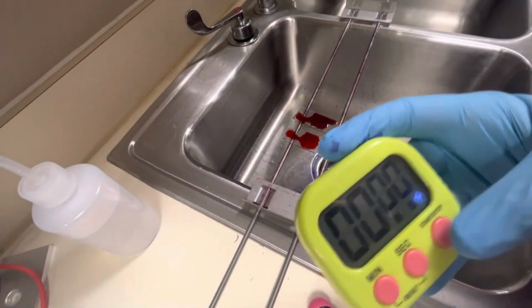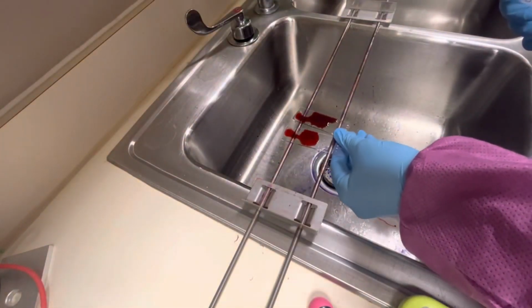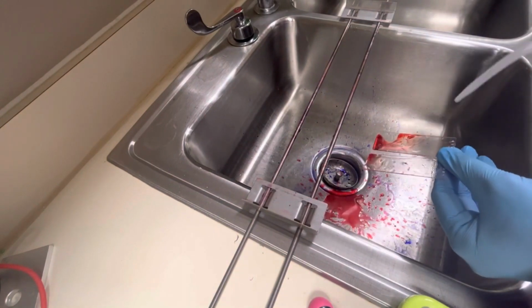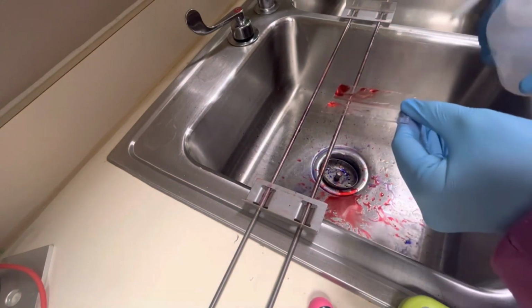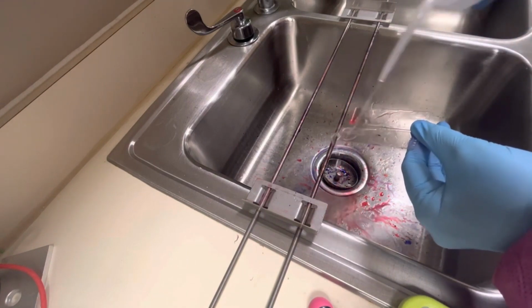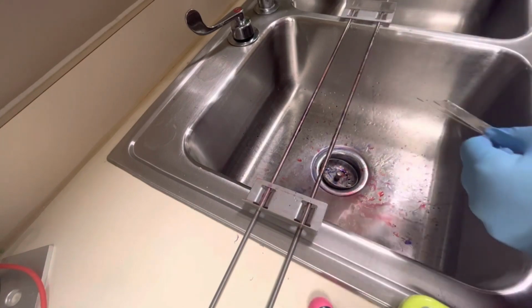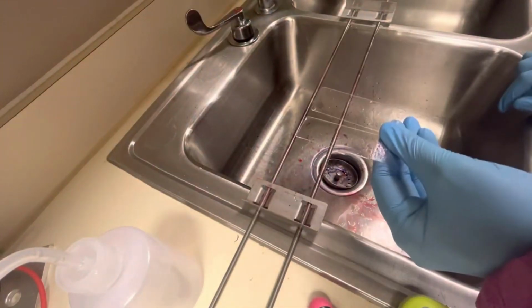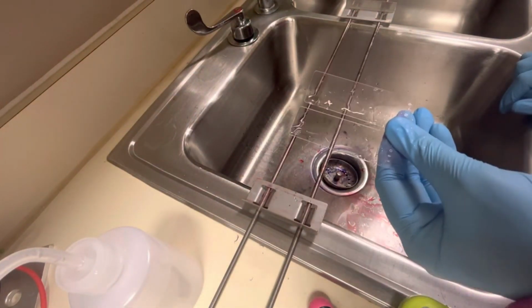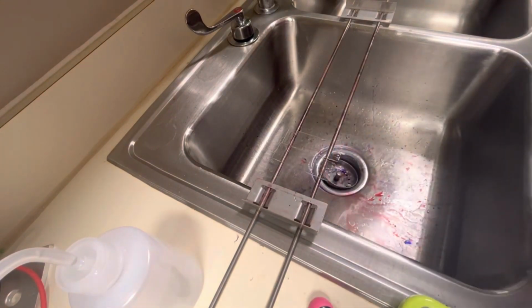Okay, you hear my timer. Let's turn it off. And the last step here is rinsing off that safranin with this water. Oh goodness, I'm losing water. There we go. A nice rinse. Okay. So now we're going to let these dry, and once they're completely dry, of course, we're going to look at them under the microscope. So I'm going to let these dry, and I'll see you at the microscope momentarily.